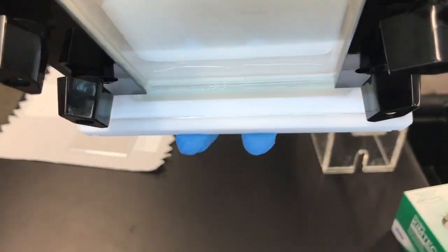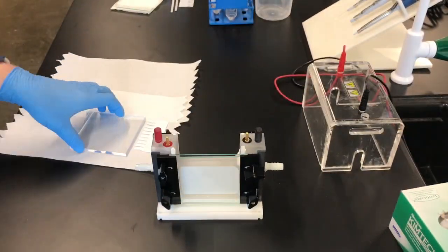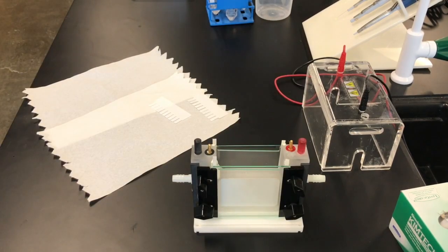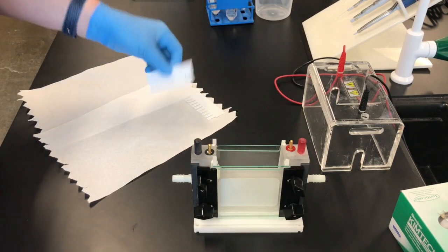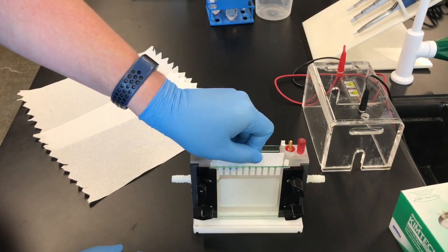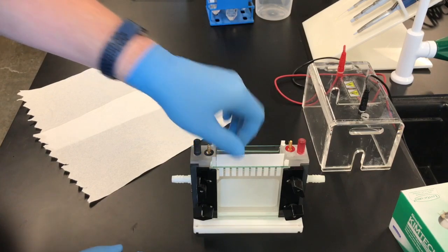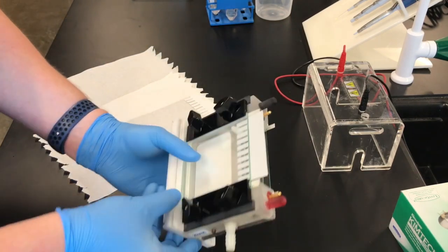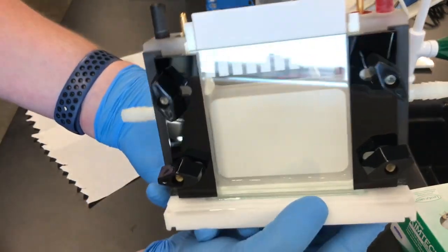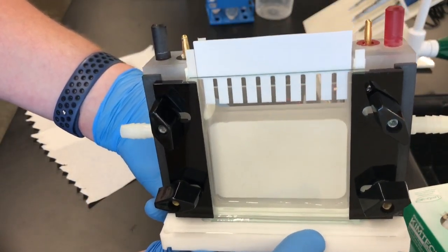On the other side, we're going to use the acrylic plate and do the exact same. For this demonstration, I'm actually running two gels so it looks a little bit different, but we're going to take the combs and place them in between the plates. Make sure that they're level and straight.